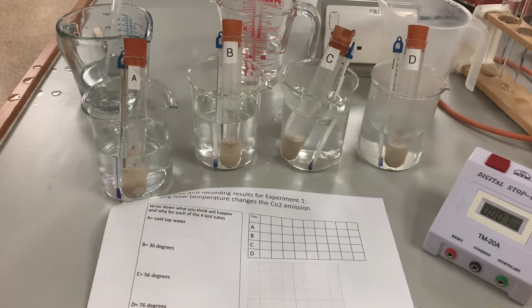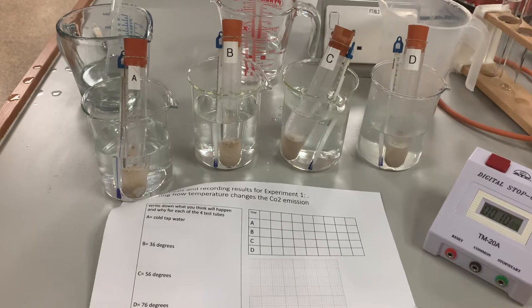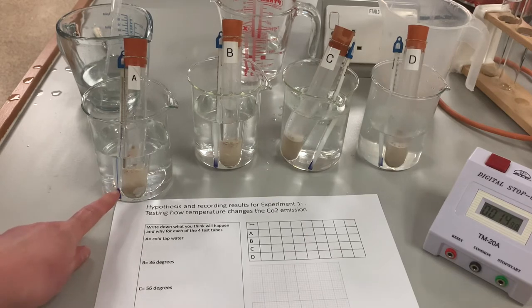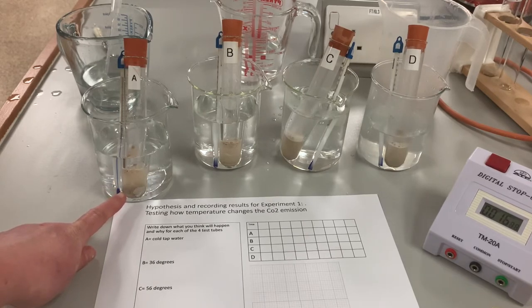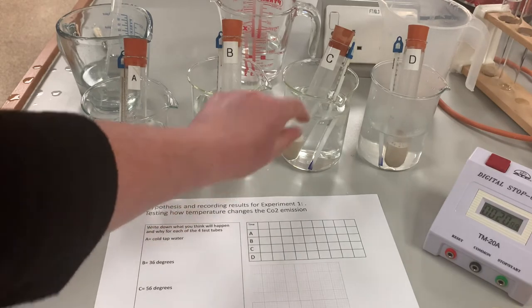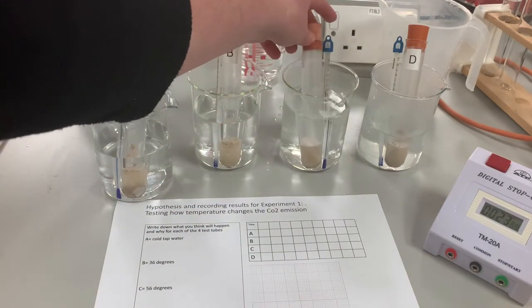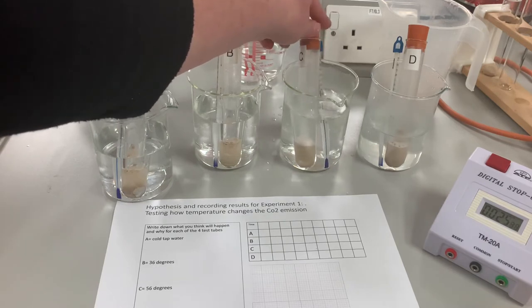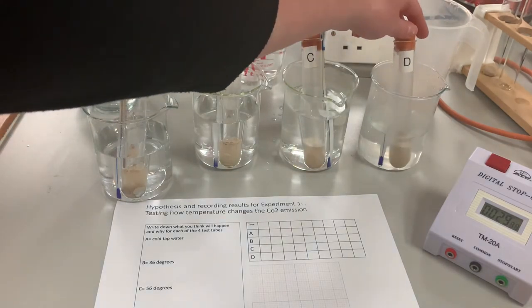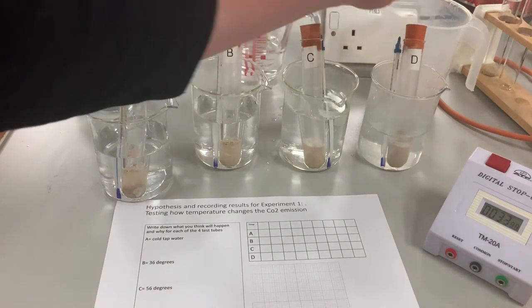I'm going to make notes of what I observe in this five minutes. A hasn't properly mixed yet, and in B some of the yeast has risen to the top. In C you can see a white area of froth forming, and D is starting to see some bubbles as well. I can write that in my notes.